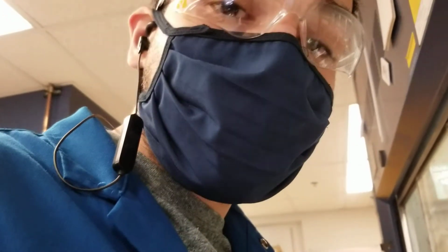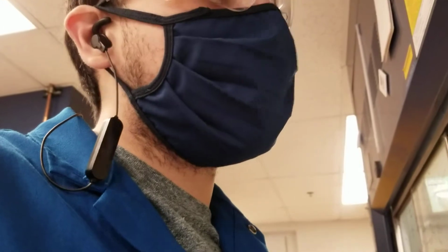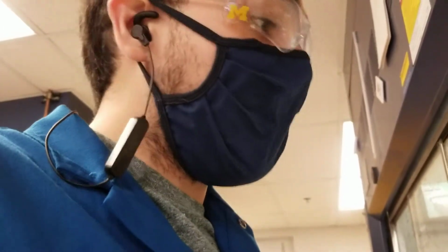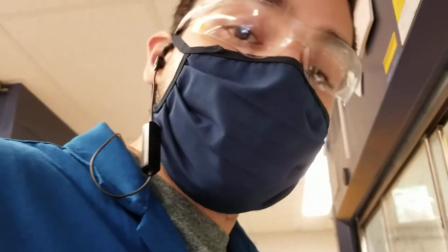So today I have an interesting situation for you where I have two different basic reactions. And when I say basic, I mean they're basic in terms of acid and basicity. But they're two very different reagents, and so the way that we have to handle those is different for that reason. But I'll go ahead and show you.